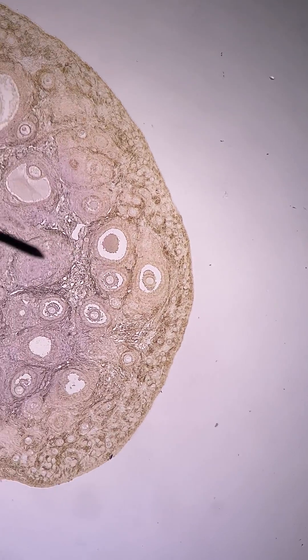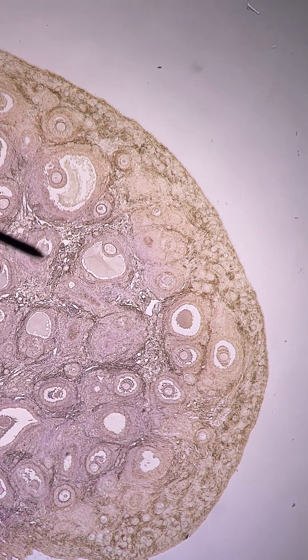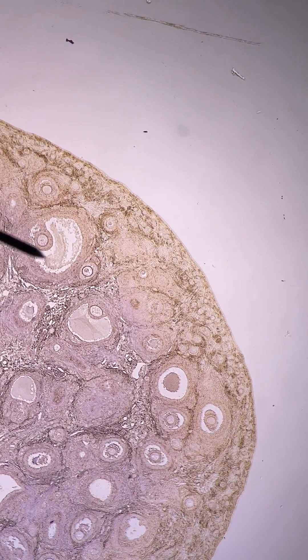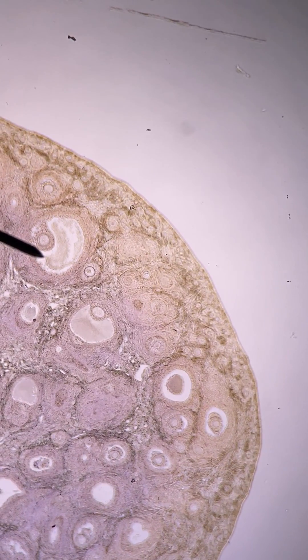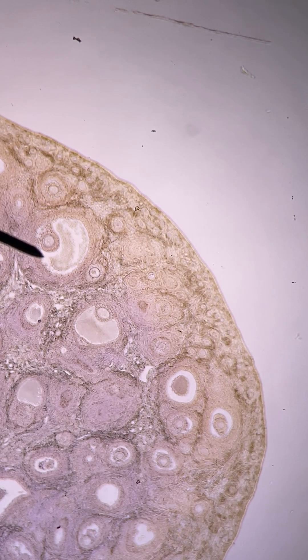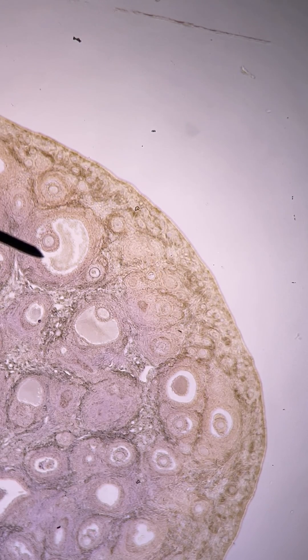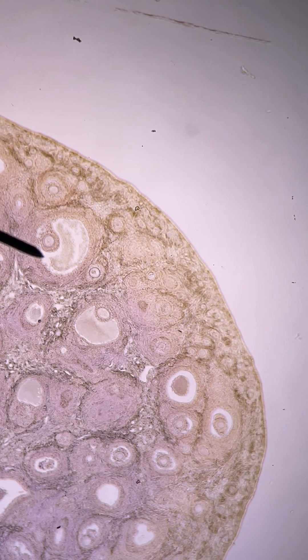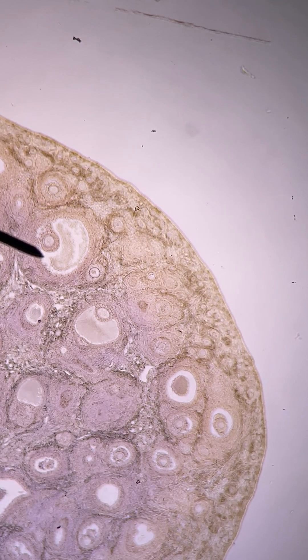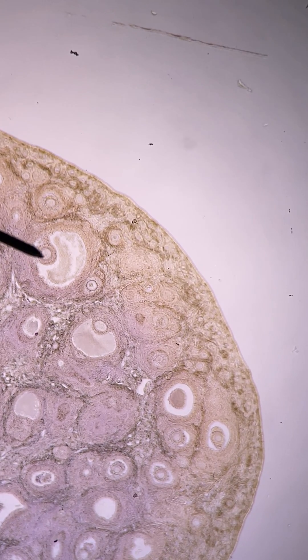We'll go to the big vesicular follicle — there's several, but this is a good one here. So it's a big vesicle. You call it either a vesicular or a Graafian follicle. There's an oocyte inside, as promised.